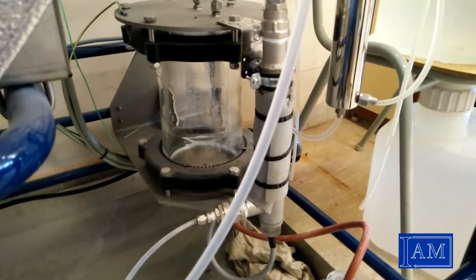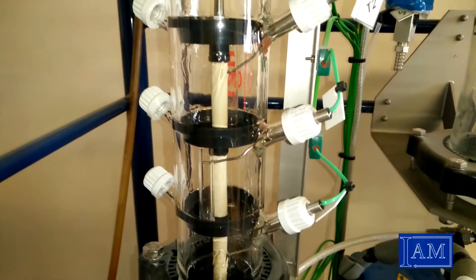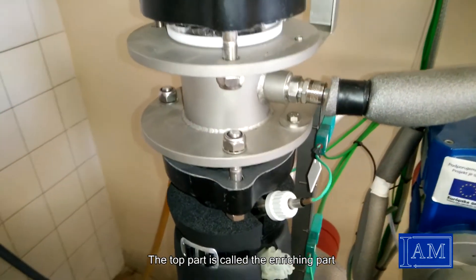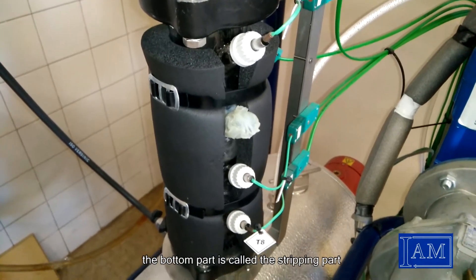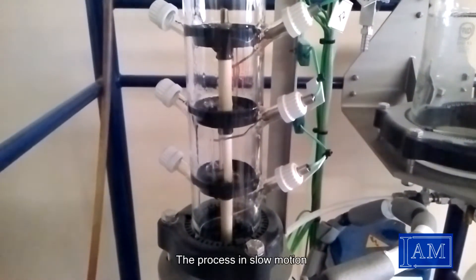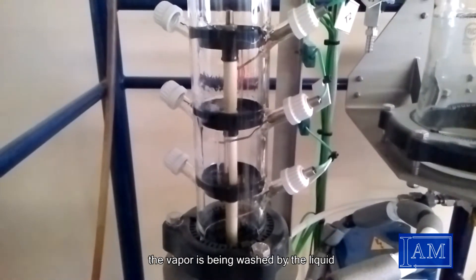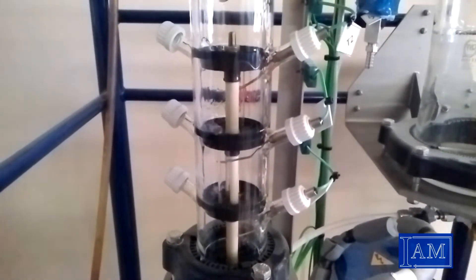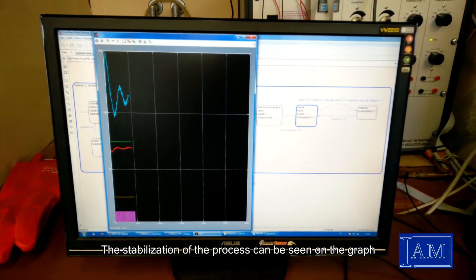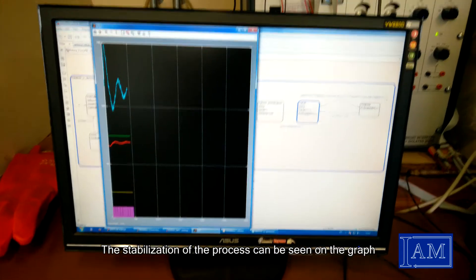Now you can see how the distillation column looks like without the insulation, and you can see the temperature sensors as well. The top part of the distillation column is called the enriching part, while the bottom is called the stripping part. You can see how it works in slow motion. The idea is that we lead the vapor through the liquid, which ensures it will have a higher concentration. Finally, you can see a graph about the distillation column, showing how it stabilizes itself over time.